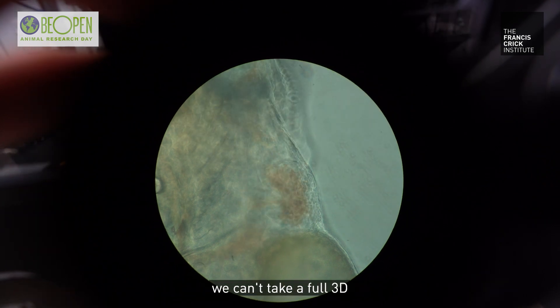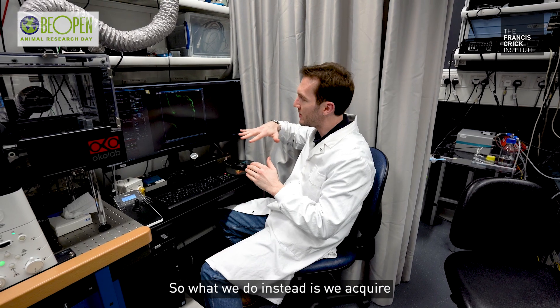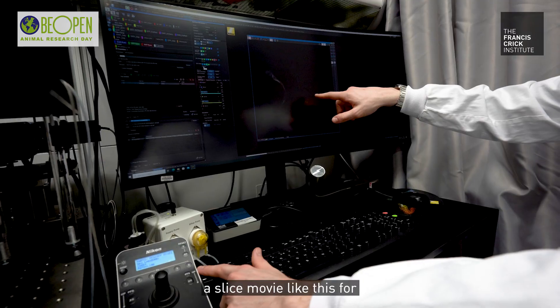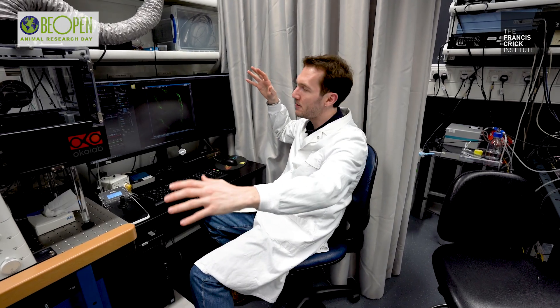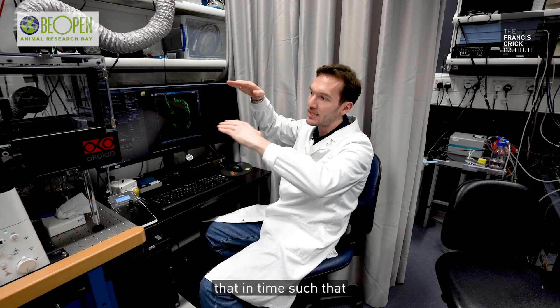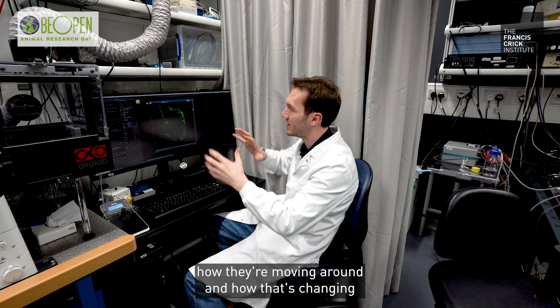Because the heart's beating so fast, we can't take a full 3D image fast enough to have a three-dimensional movie over time. So what we do instead is acquire a slice movie for every slice through the heart, separated by a micrometer or so — representing 50, 60, 70 different beats. Then using some clever AI, the computer program assembles all of that data and registers it in time so that it looks like a single beating heart. That allows us to get an average representation of where all the cells are, how they're moving, and how that's changing over time.